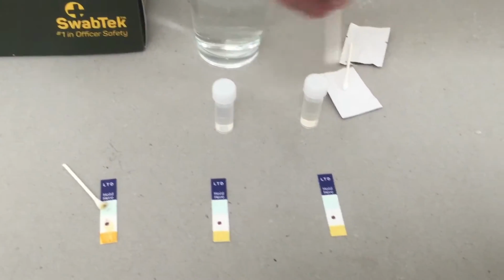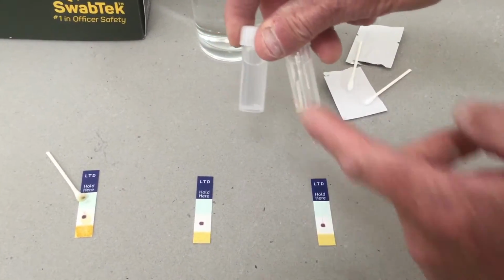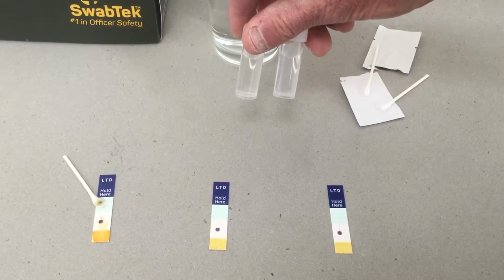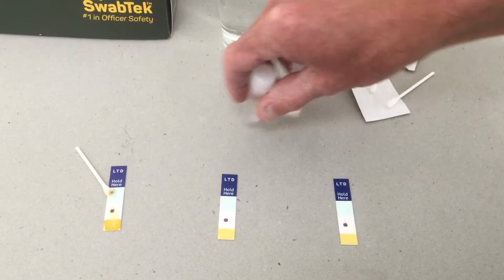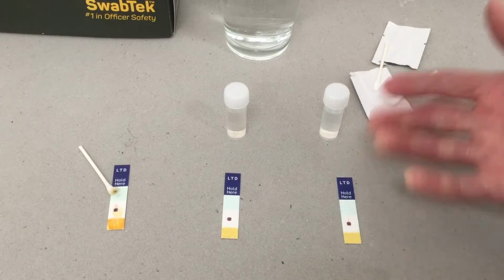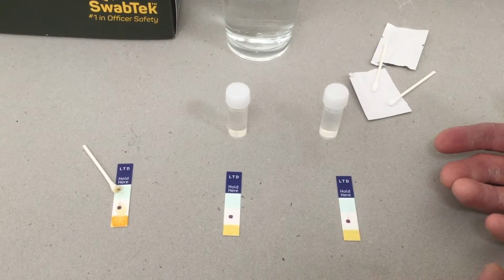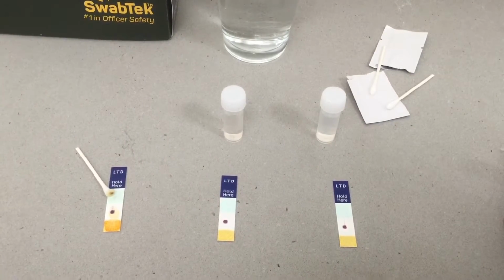Now, these two suspicious liquids here look identical. One of them is actually tap water, I don't know which one, and one of them actually has liquid explosive precursors in it. So I really don't know which one's which. I'll mix them up. But essentially what we're looking for is either a massive colour change in any one of these test zones, which indicates that you have a highly volatile compound there, capable of being utilised as a precursor to, or actually an explosive liquid.